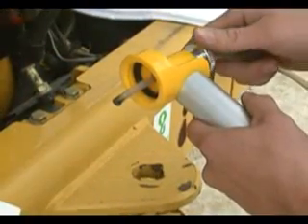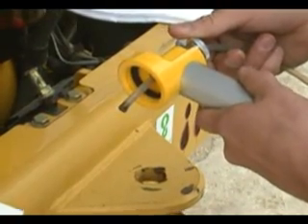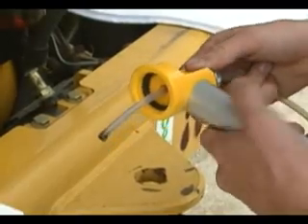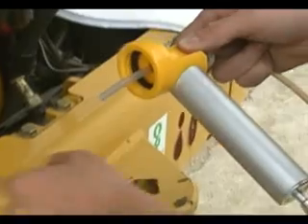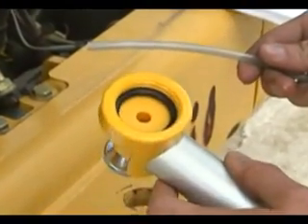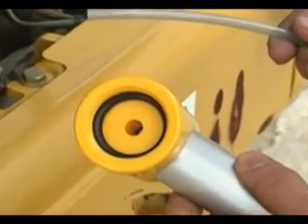If the outside of the tube comes in contact with oil, loosen the retaining nut and extend the tube through the vacuum pump. This enables you to trim off any contaminated tubing. Then the tubing can be retracted. This minimizes the oil contamination that builds up inside the vacuum pump. If you don't do this, future samples taken with this vacuum pump may become contaminated.